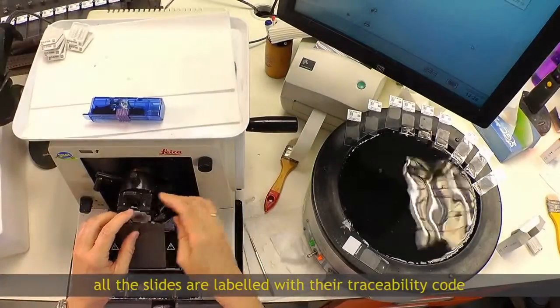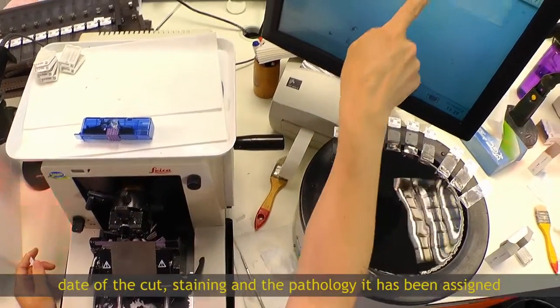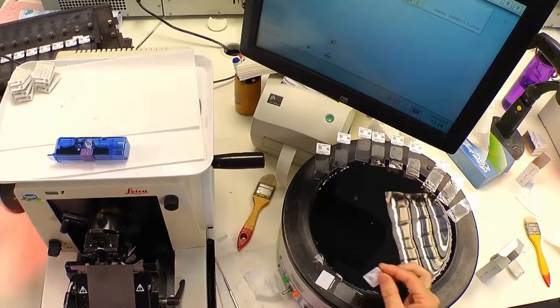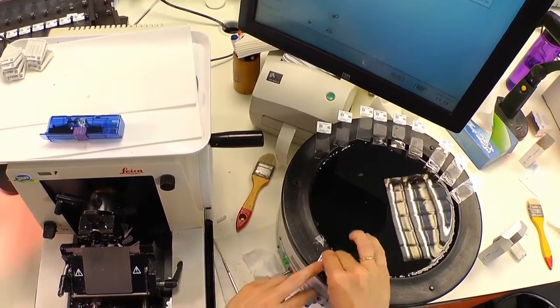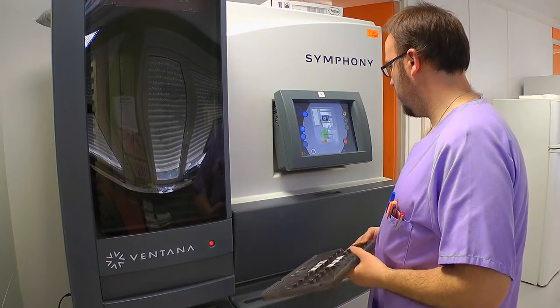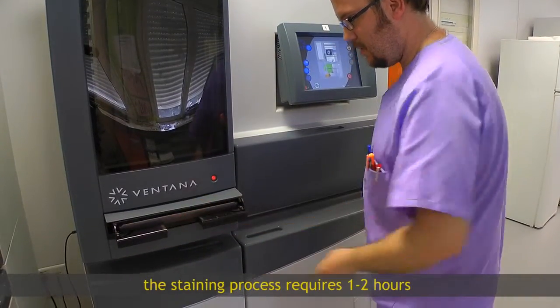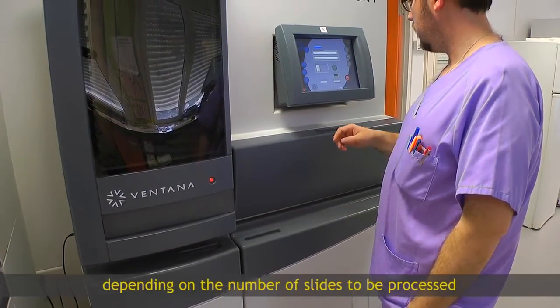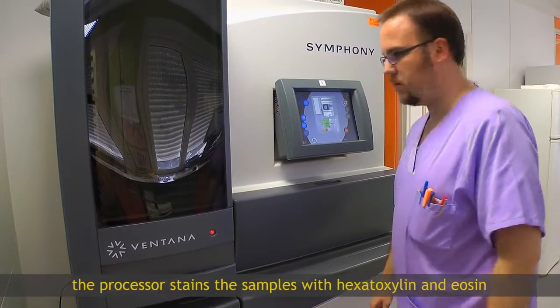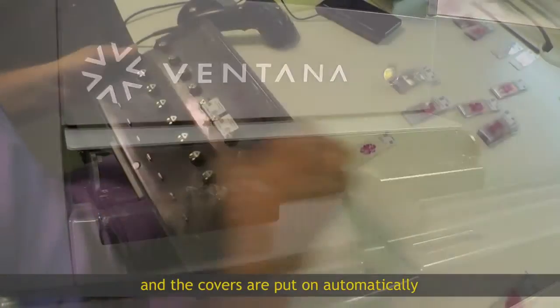All the slides are labelled with their traceability code, date of the cut, staining, and the pathology it has been assigned. The staining process requires 1 to 2 hours depending on the number of slides to be processed. The processor stains the samples with hematoxylin and eosin, and the covers are put on automatically.